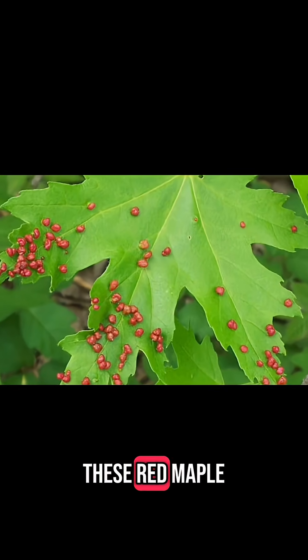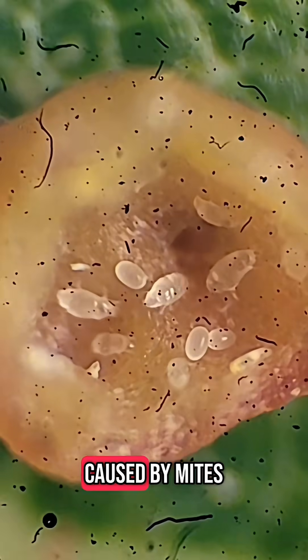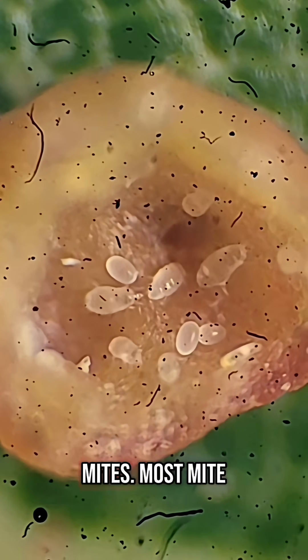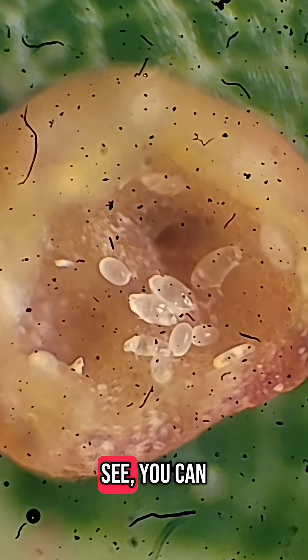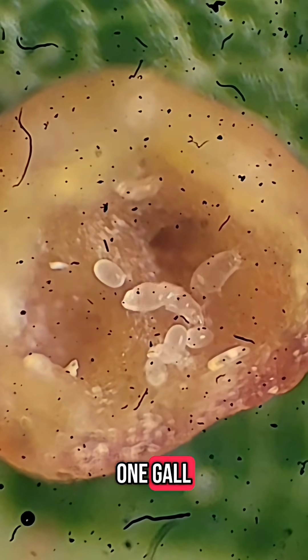First up are these red maple leaf galls. These ones are caused by mites — eriophyid mites. Most mite galls are caused by these guys. As you can see, you can get a ton of mites in one gall.